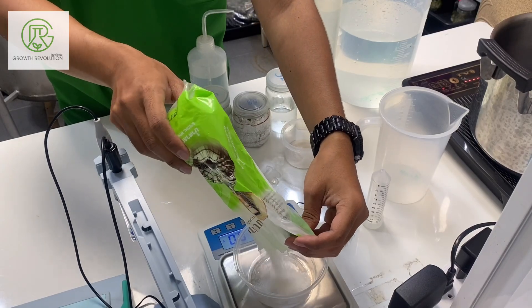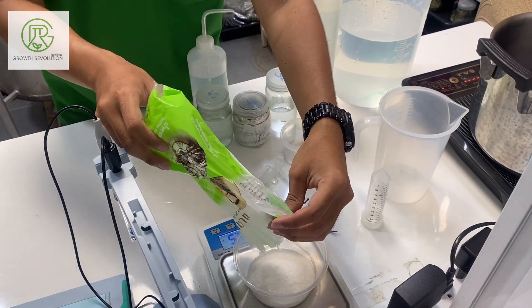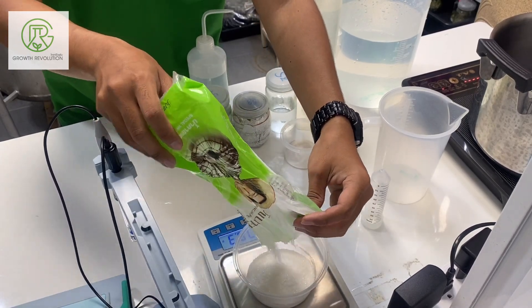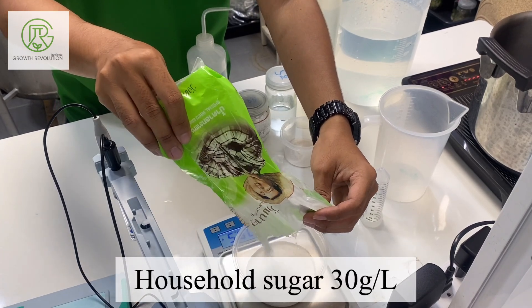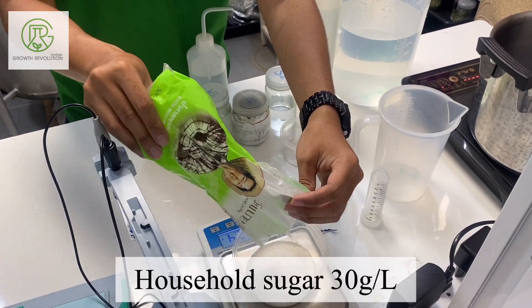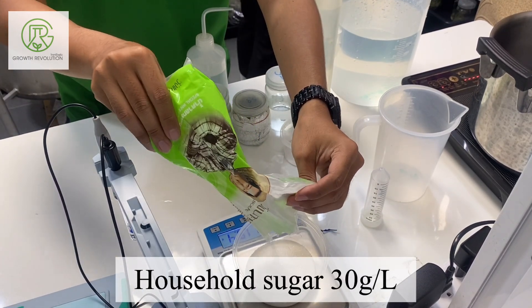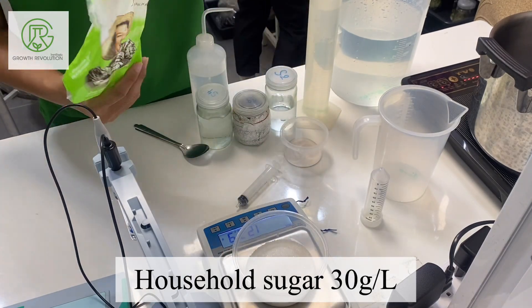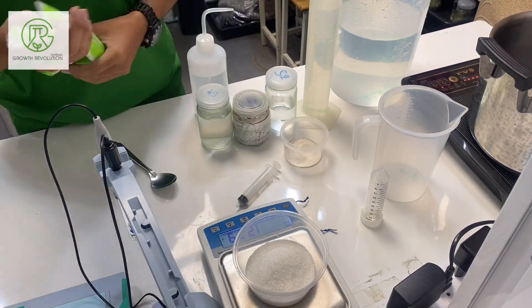Then we are going to measure the sugar. The amount we use is 30 grams per liter, so we need 120 grams for 4 liters.